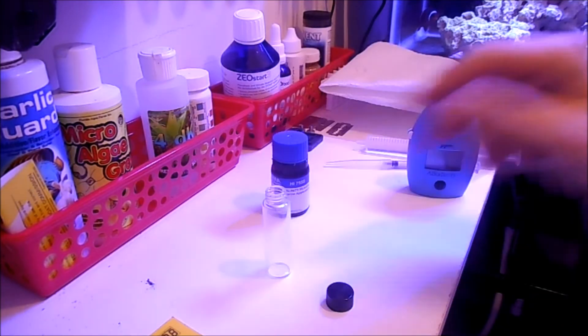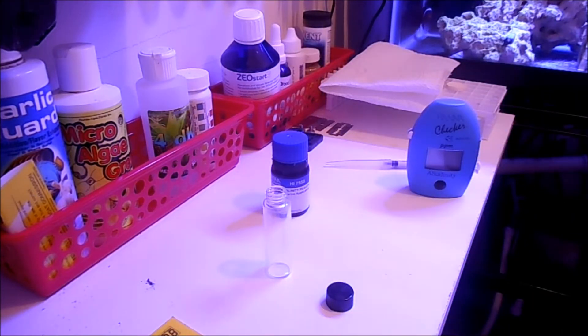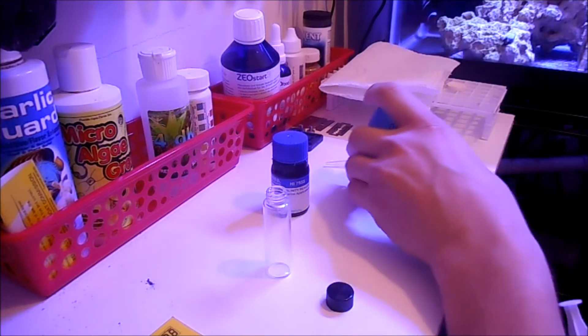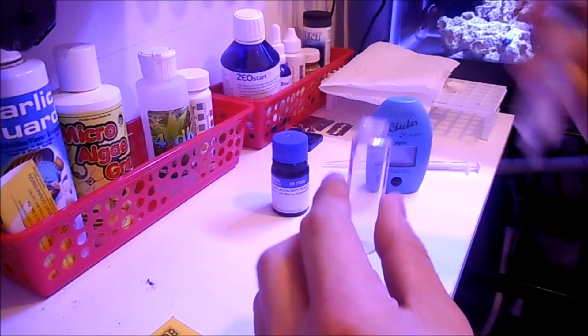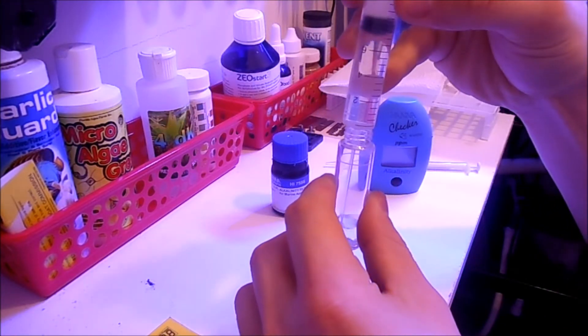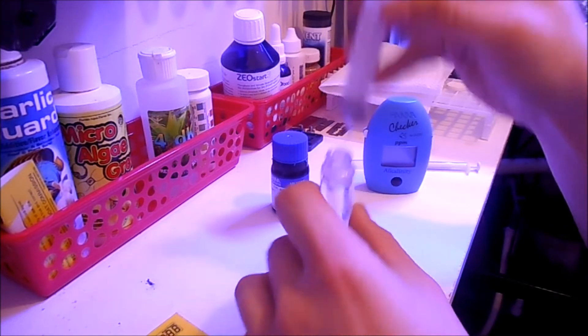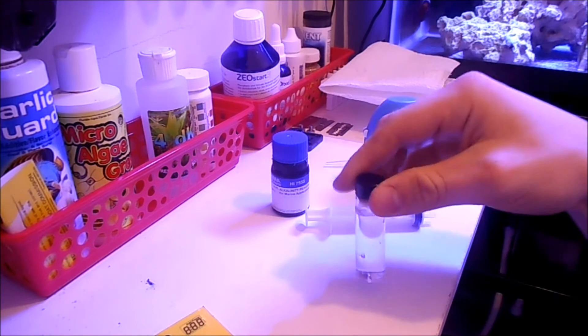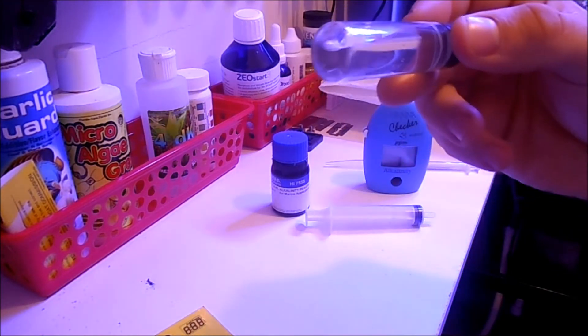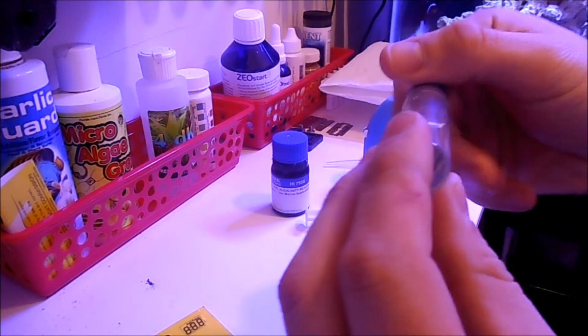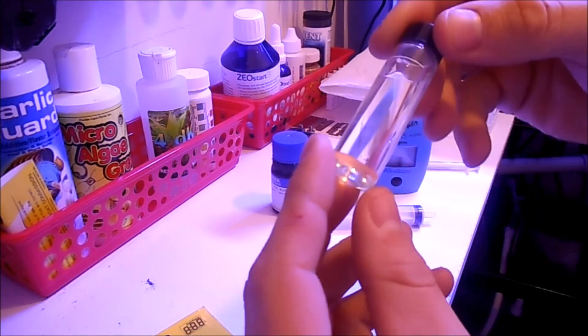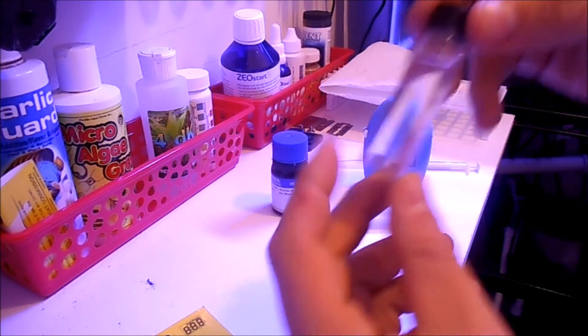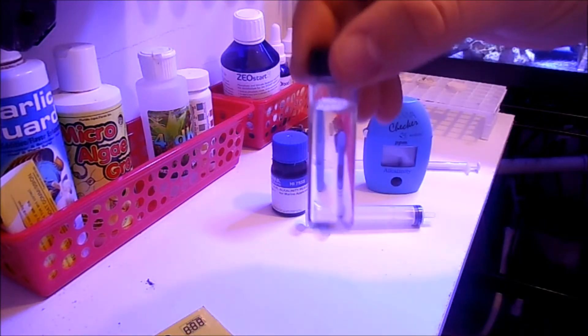We'll go ahead and get started. First thing you're going to do is fill up 10 milliliters of water. I got 10 milliliters here. Now what you want to do is make sure there's no bubbles in it, so I always do a little quick swirl to make sure there's no bubbles. Get out as many as possible.